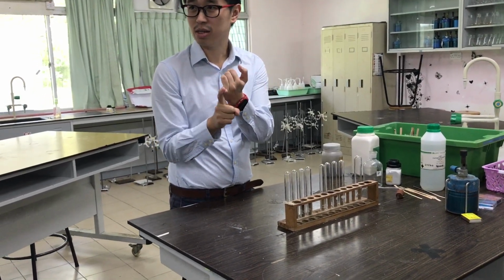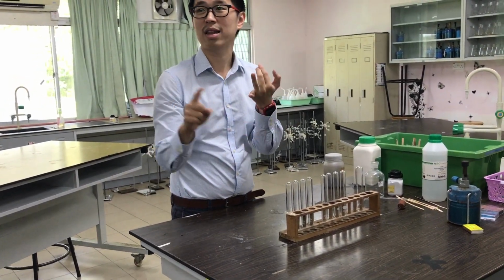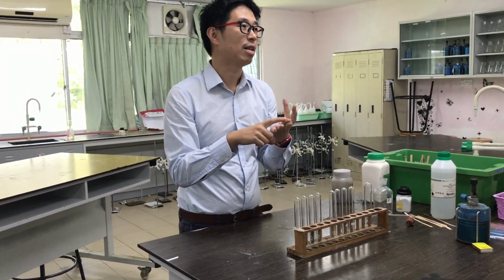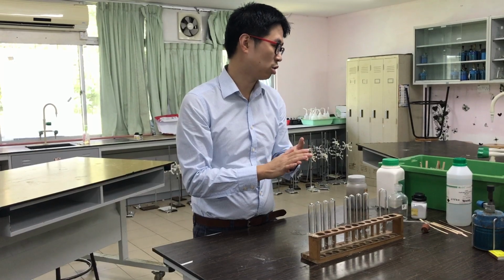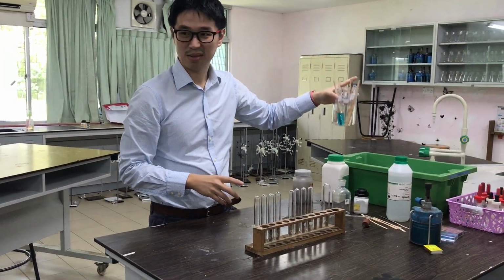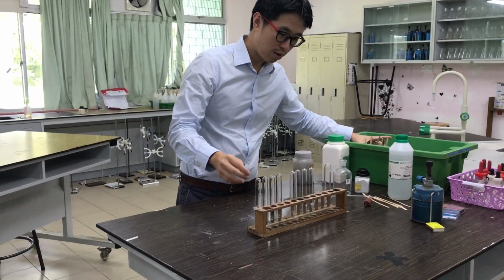Test for cations, I did it yesterday. Test for anions, I'm going to do it today. Test for gases, I'll do it today. And the last one is the flame test, which you already did before, and we can do that later on. Okay? Alright, let's do the anion first.